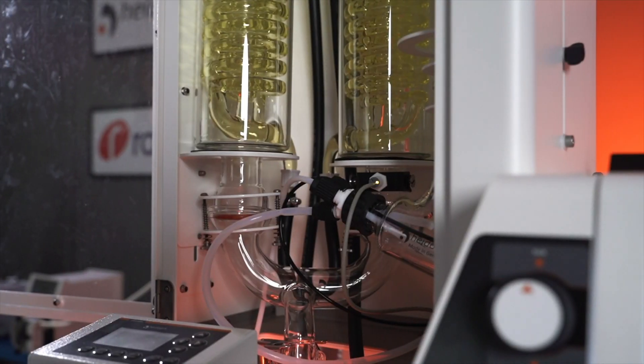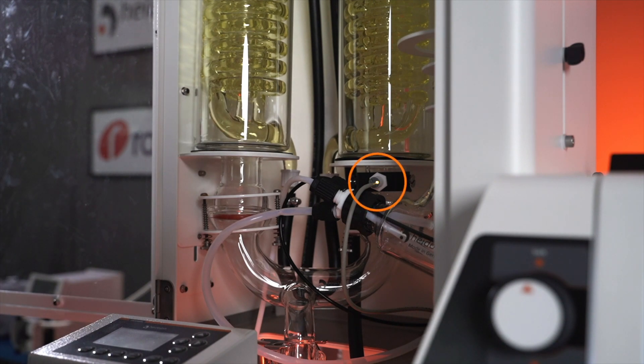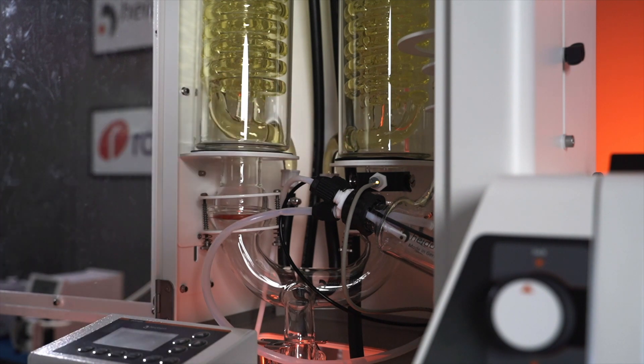The first sensor I'll be discussing is your cutout sensor which is located right on the back condenser at the very bottom there. That sensor is in place in case there's any failures with the valves below the condensers in which your condensate starts backing up and backfilling the condensers. Once the product line hits that sensor level, it'll cut out the entire system. Now the code that you will see on the screen will be error 1.